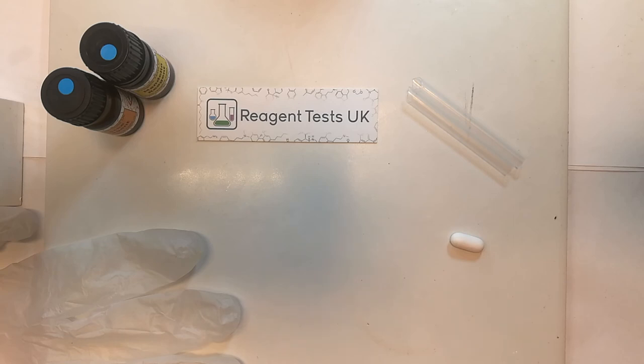When you are cleaning up reagent tests it is sufficient to use soap and hot water. And that's really all you need to get started. The next step is to prepare a scraping of your sample and perform the test according to the instructions. We've got other videos available and written instructions that come with every kit. We'd be happy to answer any questions about how to use the kit or interpret your results by emailing us from our website.